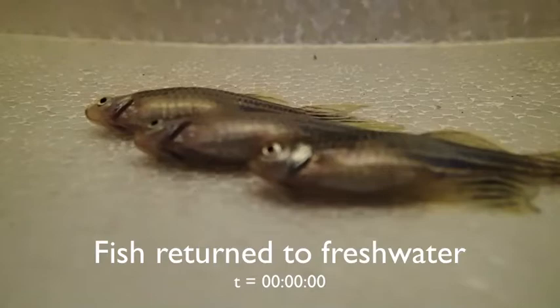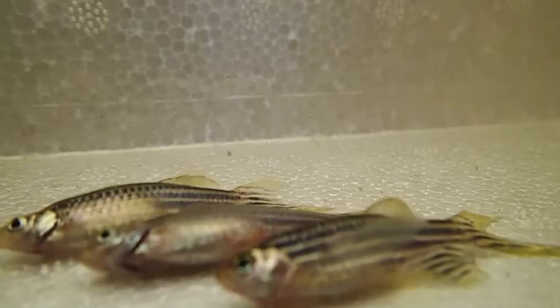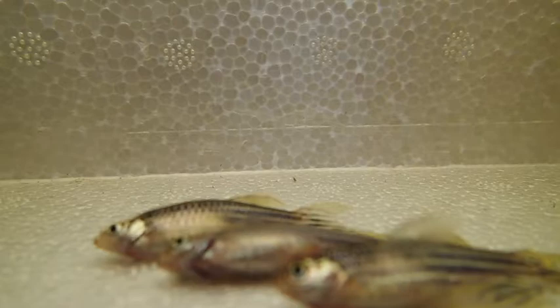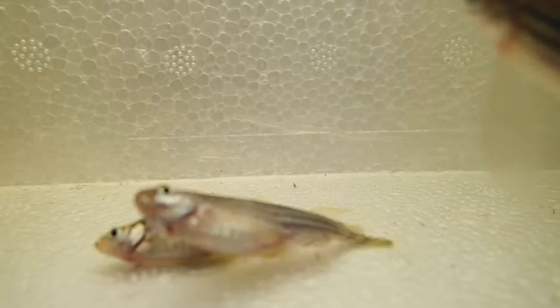Now we've put the fish back into fresh water. You can see the respiratory rate is slowly increasing — the fish are going through the reversal of anesthesia. You get erratic respiratory rates and stronger movements. The heads are shaking side to side mainly because of opercular movements, and the fish slowly regain consciousness and start swimming.